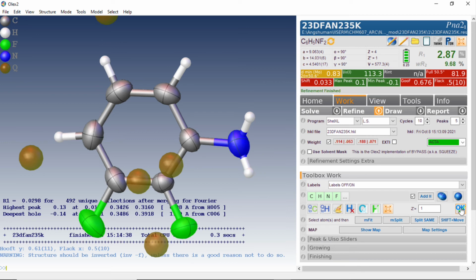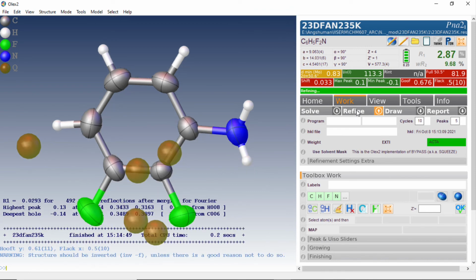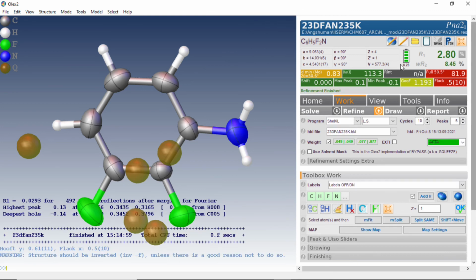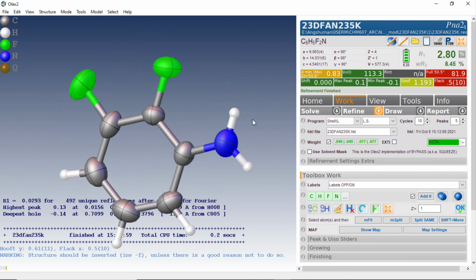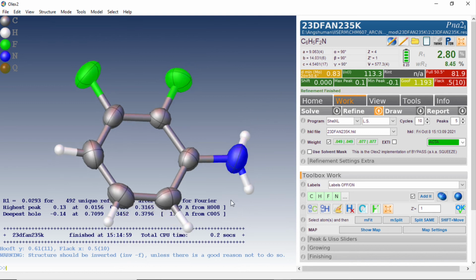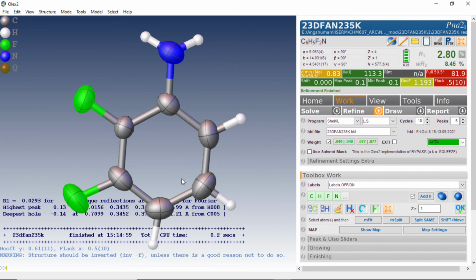So by clicking OK, it gives you the correct formula, and a few rounds of refinement will convert everything into green. The points which are orange or red here are the problem points, because the data is not a very good data, the crystal did not diffract, and the standard problem of in situ crystallization is that we cannot rotate the kappa during the measurement, and that is why the completeness is always less. But what we can show you here, the crystal data which was not possible to index using a normal procedure, the structure can be solved if we follow this method.